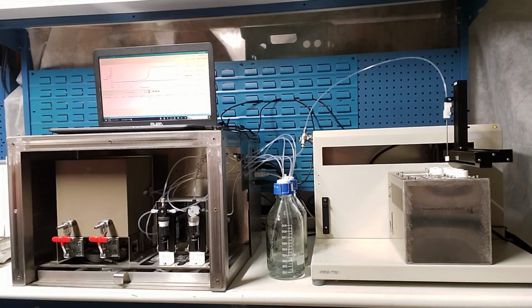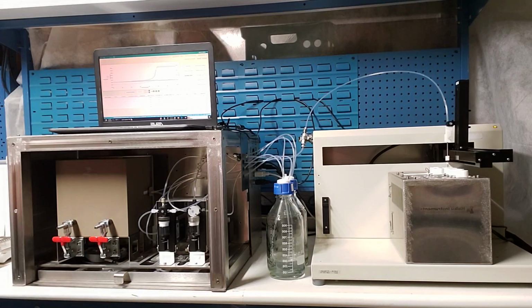We are watching sample loading and automated analysis of polymer samples for intrinsic viscosity on the Model 575 Intrinsic Viscometer from Haiku Instruments. Lined up right now are 5 samples. These are HPMC, running in water, dissolved at 40 degrees Celsius for 30 minutes, and then transferred to the oven for subsequent analysis, again at 40 degrees Celsius.